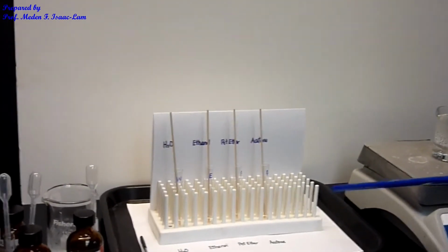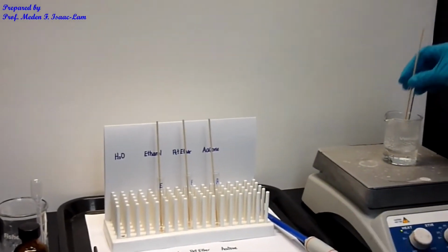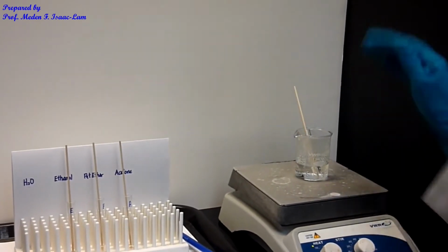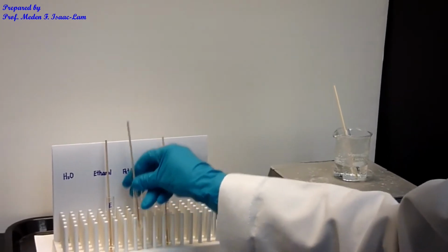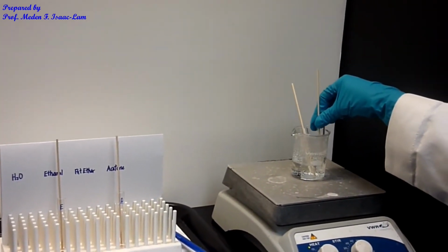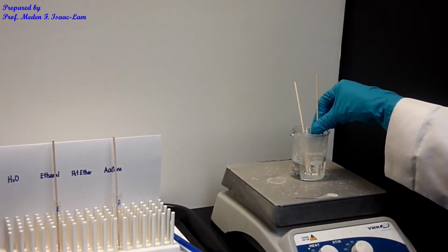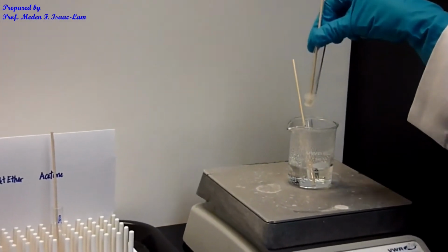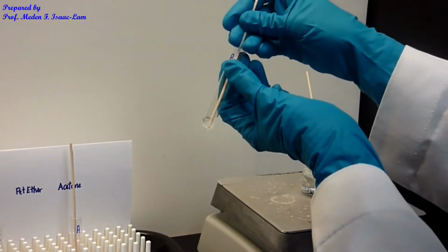Okay, so we're gonna put first water. I'm gonna stick it here, and then we observe. I don't want it to boil over, so I'm gonna watch it. And then petroleum ether I'm also going to stick into the water bath. All right, I don't want it to be boiling over, and actually this one is boiling already, so I'm gonna remove it and then see if I was able to dissolve it.